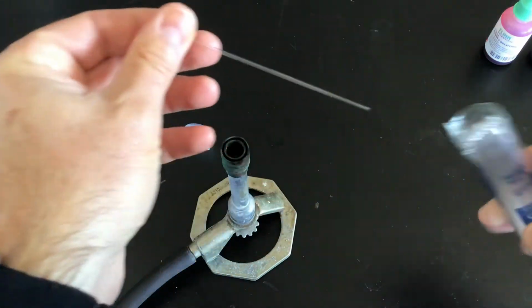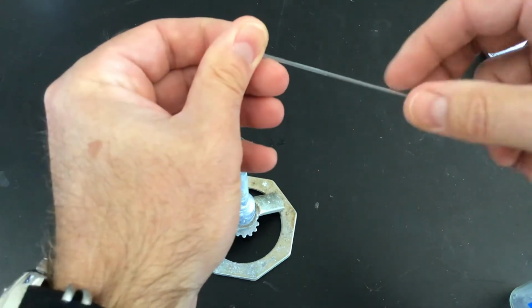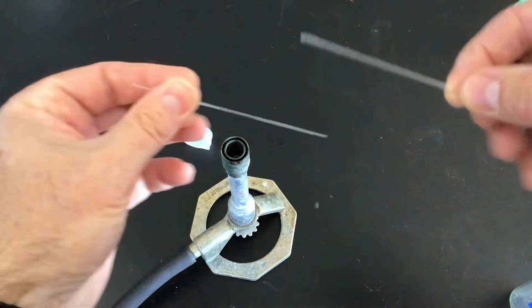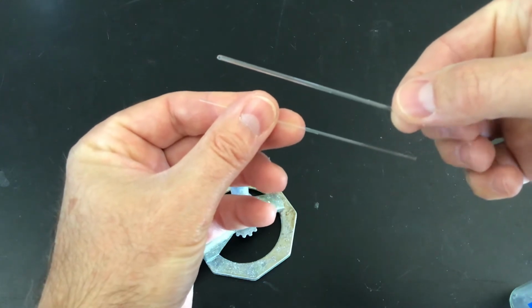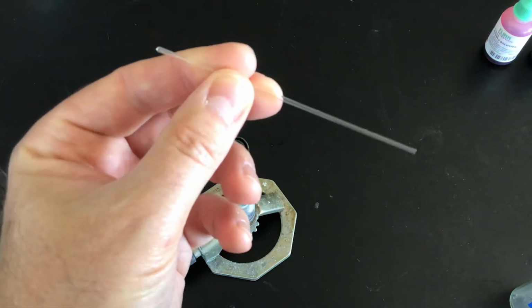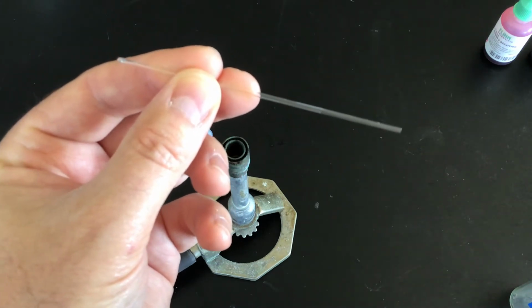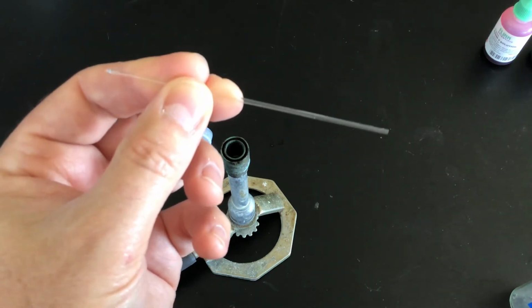A melting point tube has an open end, which I'm showing on the right, but it also has a closed end. Ideally we would be using a capillary tube, which I've got over here on the left. The difference is that in a capillary tube both ends are open. The reason we're using these melting point tubes is because, maybe another chemistry teacher had ordered them, and we literally have thousands of them. So we're going to be using these. It means we're going to do a little bit more work than we normally would, but we've got this resource and we're going to use it up.